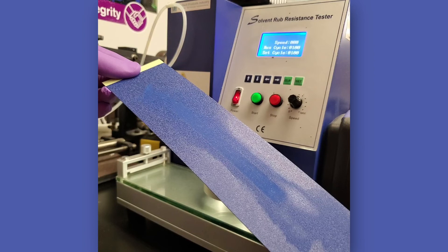It is recommended that any breakthrough that is observed a half inch from either end of the stroke be disregarded. Failures at these stroke turnaround locations are often heel break and are not indicative of the actual solvent resistance of the coating. The size or length of this area at each end of the stroke to be disregarded must be agreed upon between producer and user.